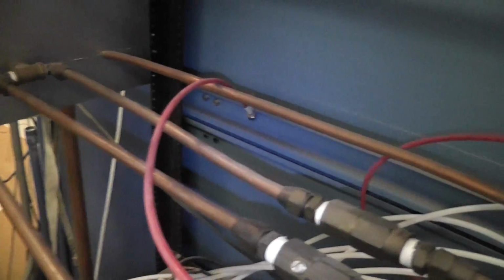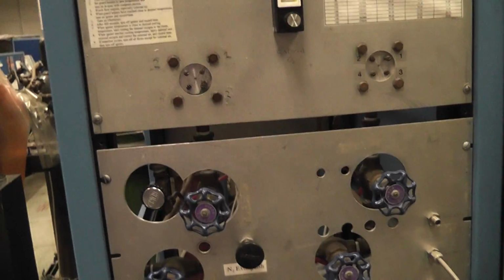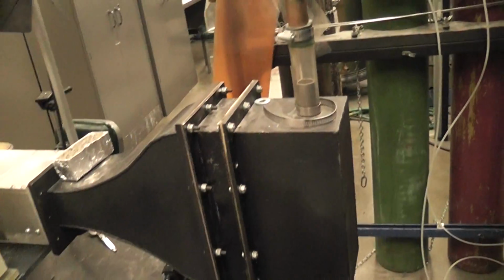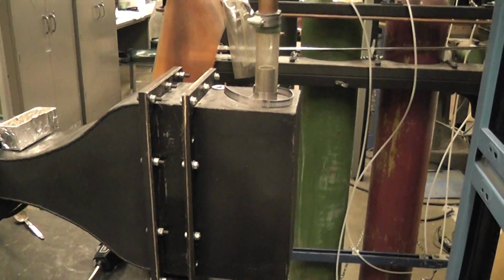Okay, and then a whole bunch of other piping that relates to how this thing mixes and flows gases. We have a bank of oxygen cylinders sort of hiding behind there, and house compressed air and nitrogen. One of these outlets comes out there at the bottom, flows through this yellow pipe and into this box here, and this box is full of beads.